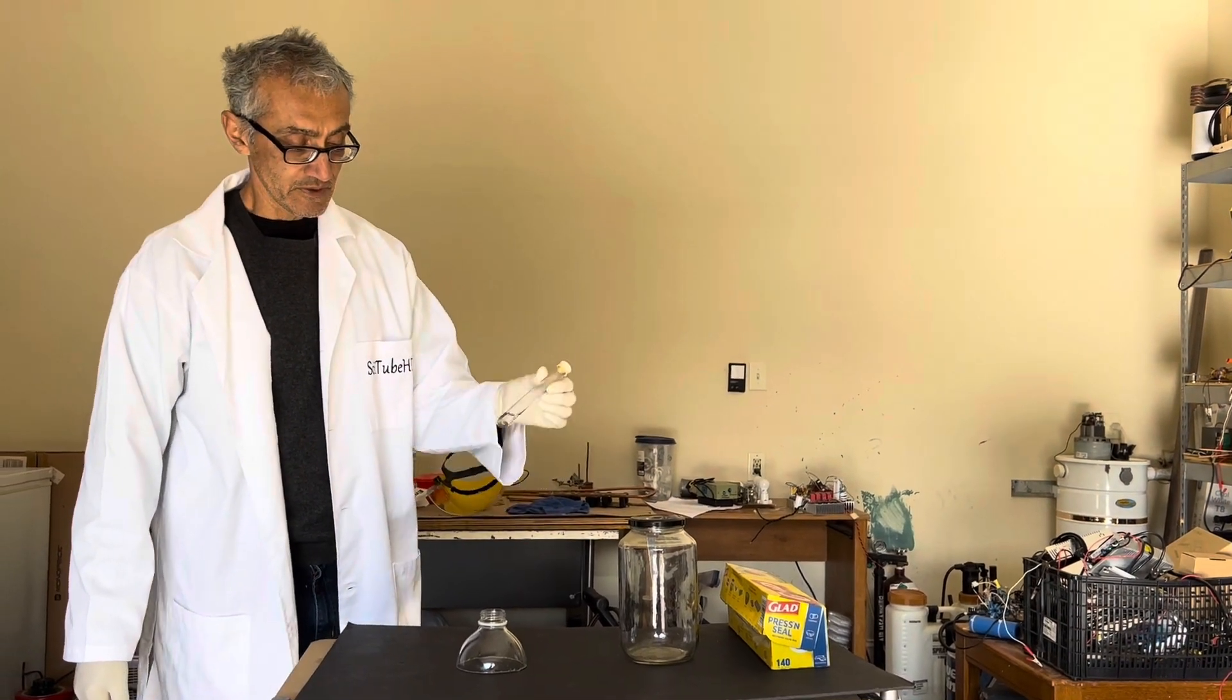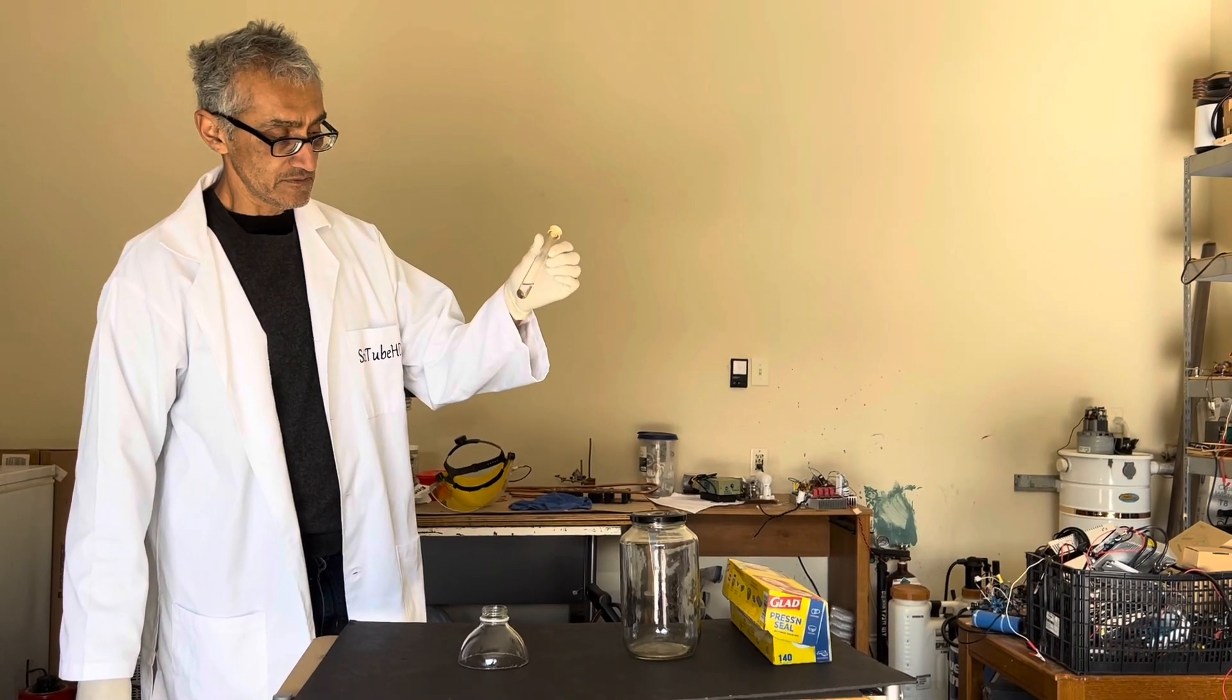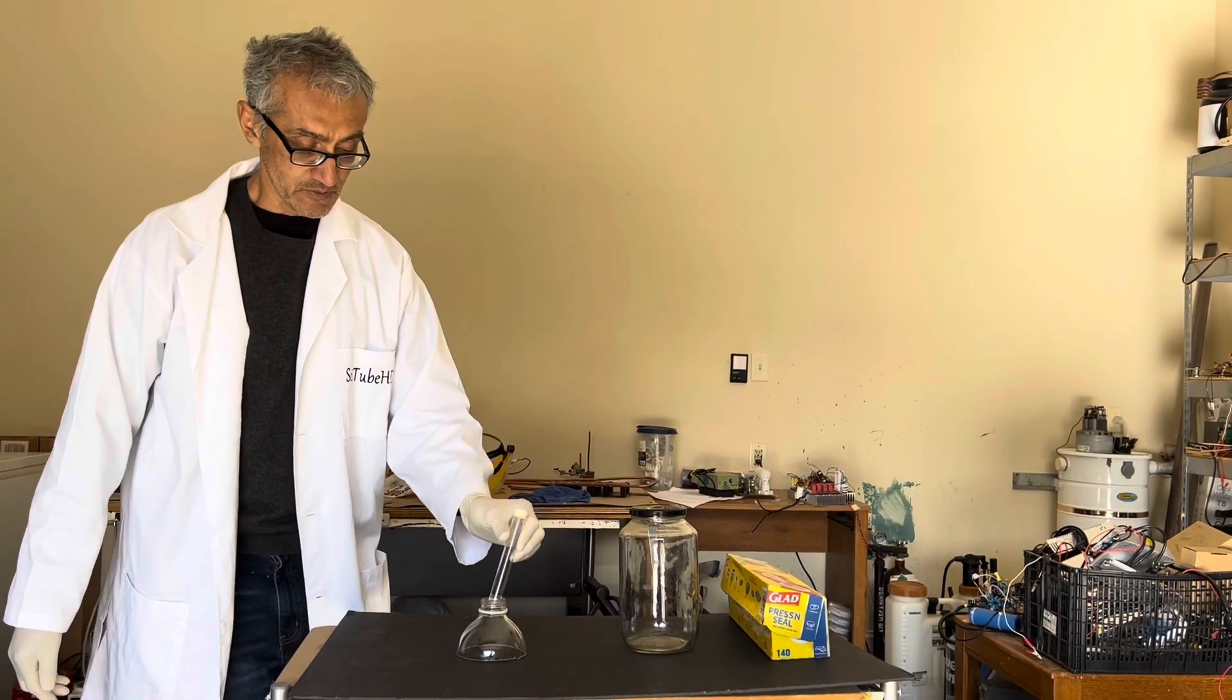In today's experiment, we're going to watch how phosphorus reacts with pure oxygen.